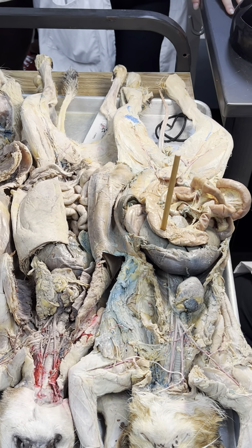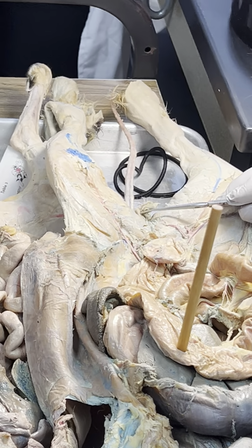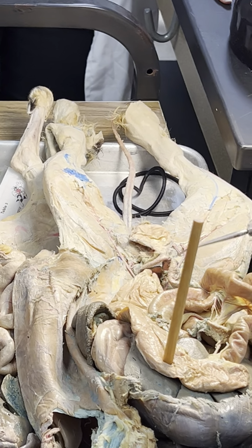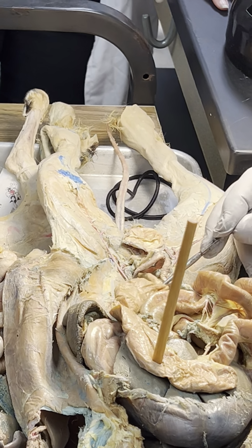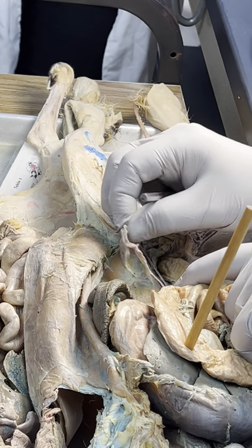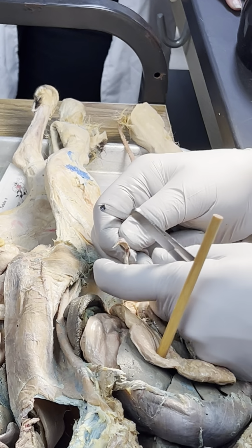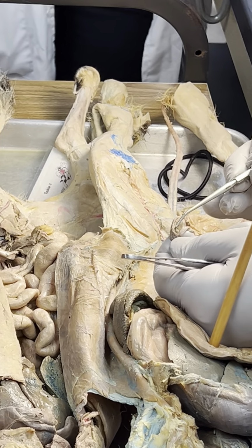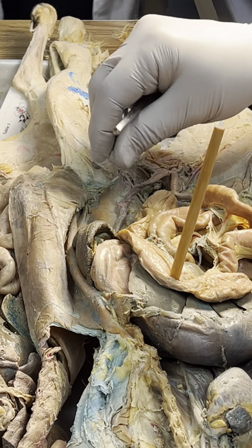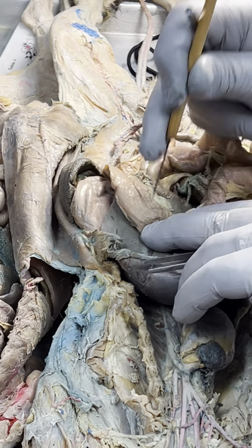What is that? Excellent. Urinary bladder. It's the only thing you learned way down here in the groin area. This does happen to be a female and it's covering the uterus, but that's only because it's there. I'm telling you that. You don't need to know that, right? But that's the uterus. These are, matter of fact, just because, the ovaries. Cool, huh? Well, you will know that for the final, though. Well, oh yeah, don't forget.